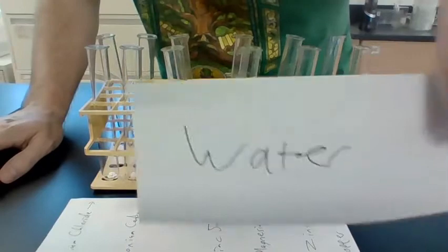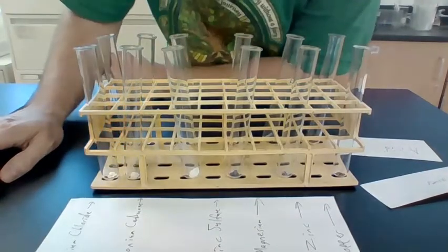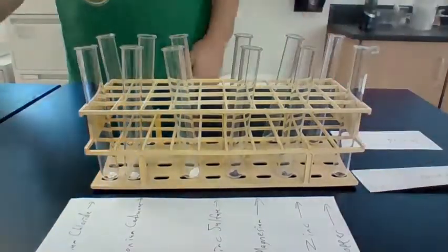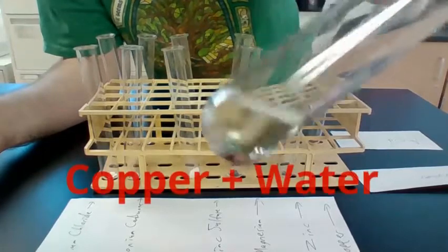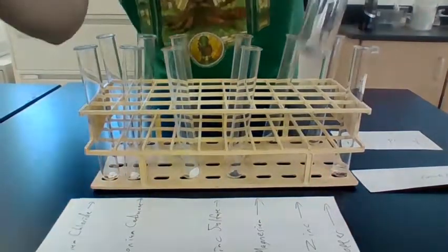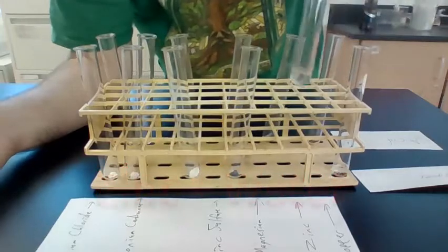Now what we're going to do is add water to each of these and see whether there's a physical or a chemical reaction. Did the copper change? Did the zinc change?